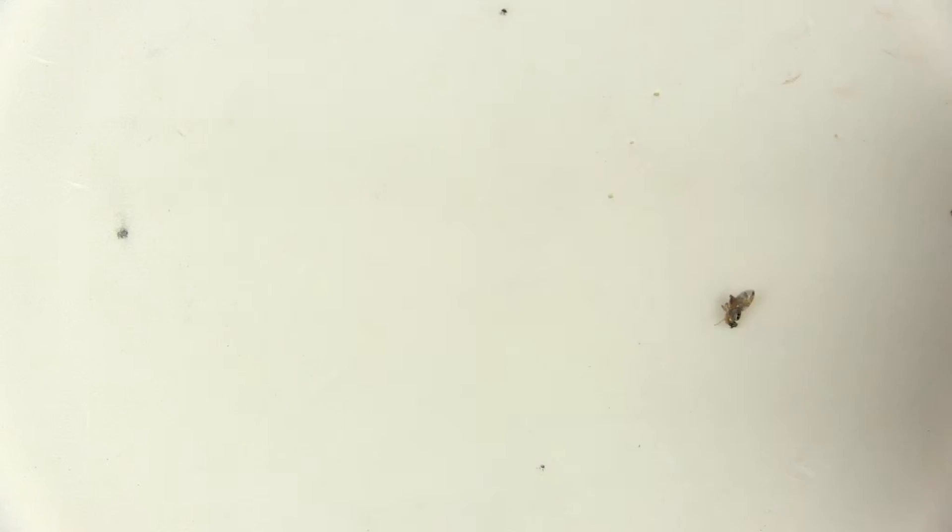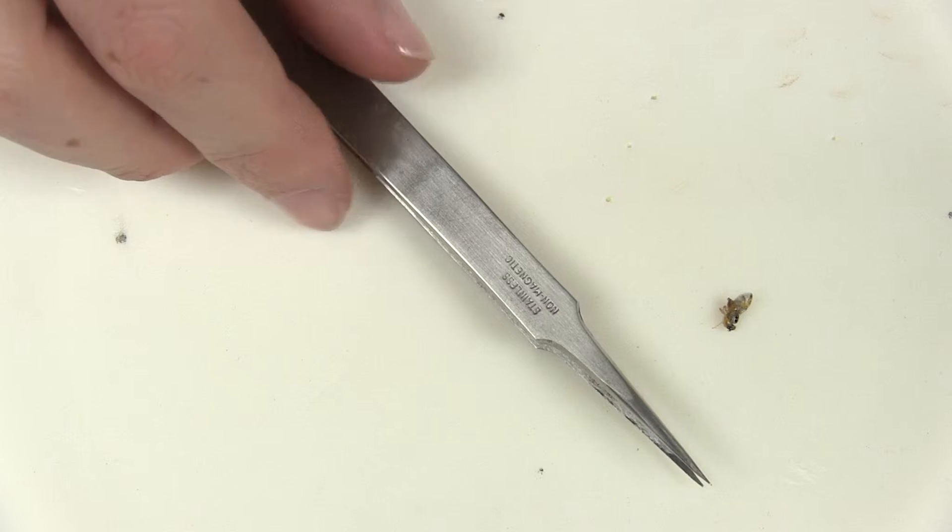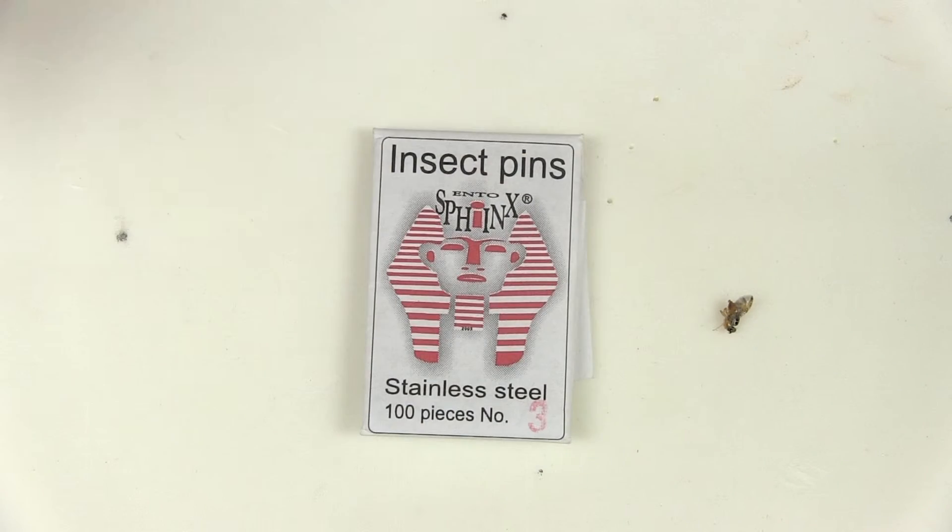You will need micro pins, fine-tipped forceps, a foam strip, number three insect pin, and scissors.